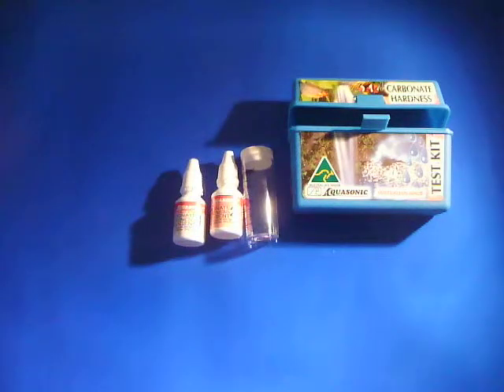Now most people will generally know a carbonate hardness kit as a KH test kit, and using this you can generate the German degrees carbonate hardness if you wish. You can do it in one of two different steps — you can either do it in 10 parts per million steps or 20 parts per million steps.